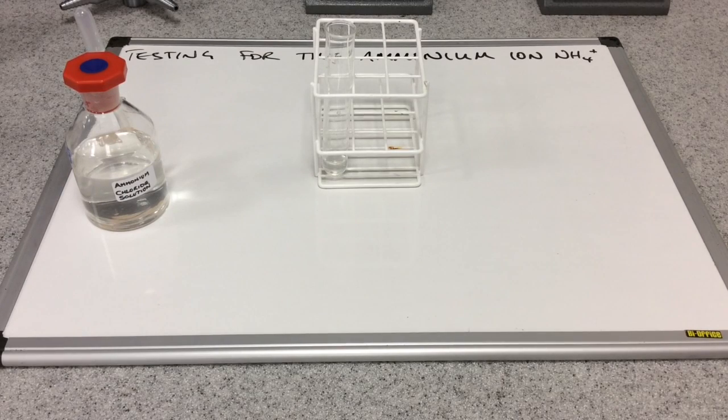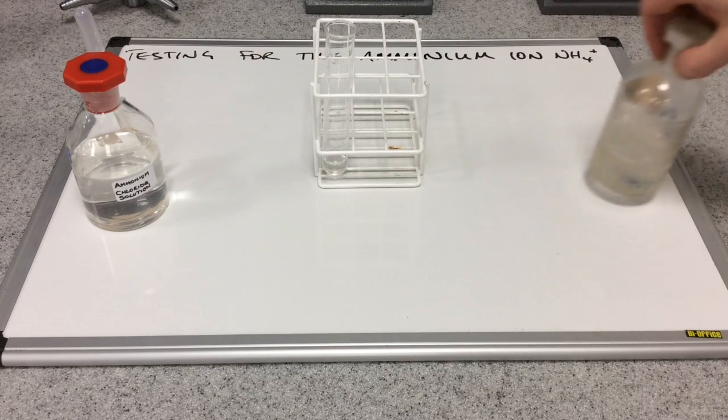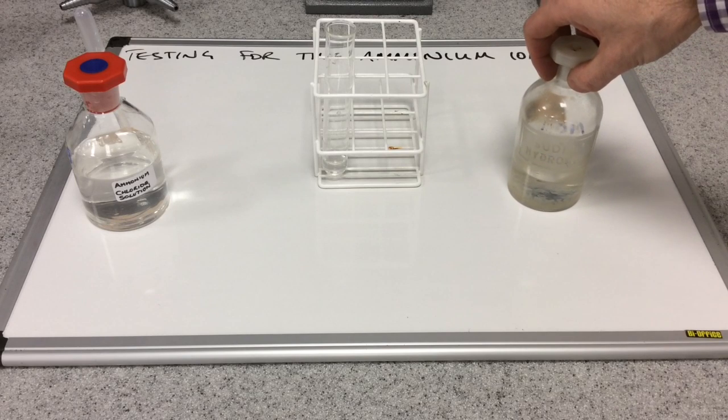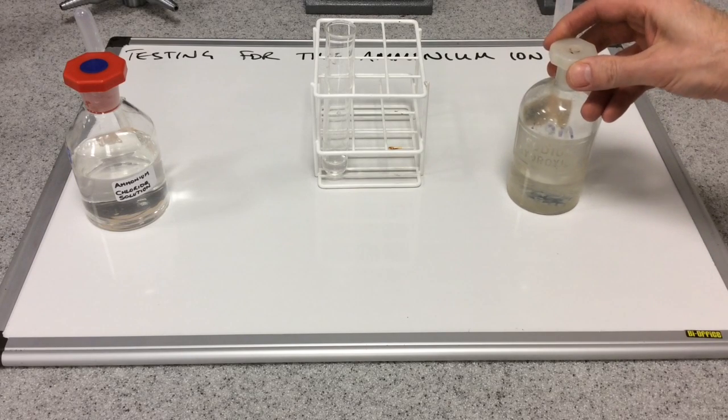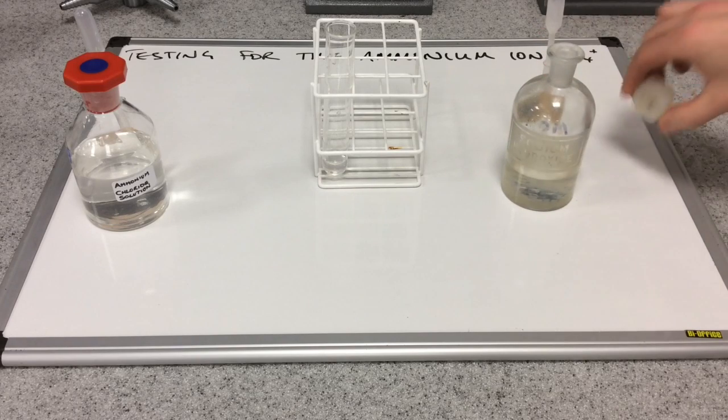In the test tube I've put a small amount of the ammonium chloride solution, and to that I'm going to add some sodium hydroxide solution. So we'll do that and have a look at what happens.